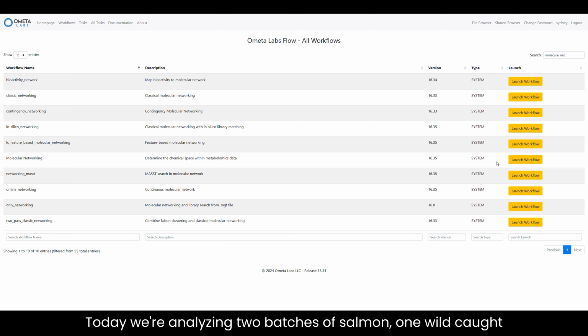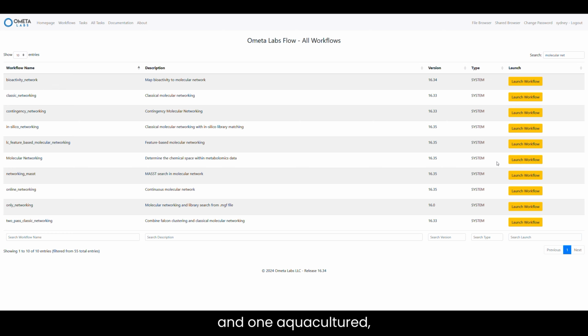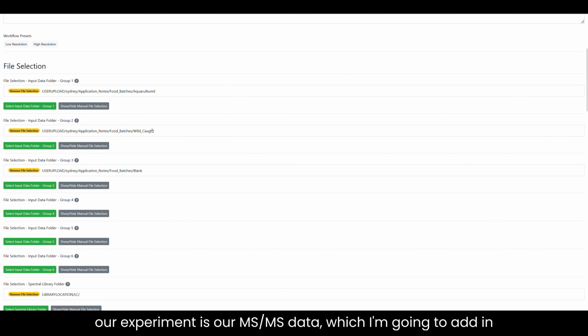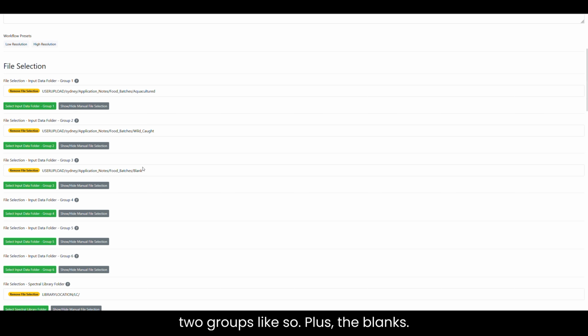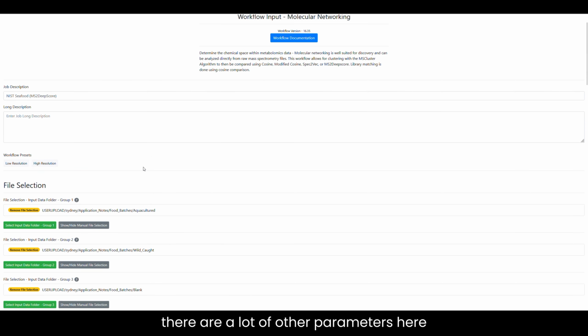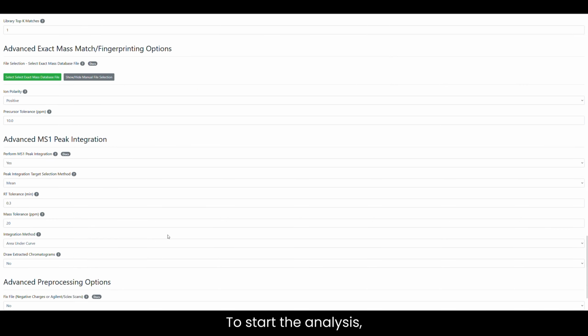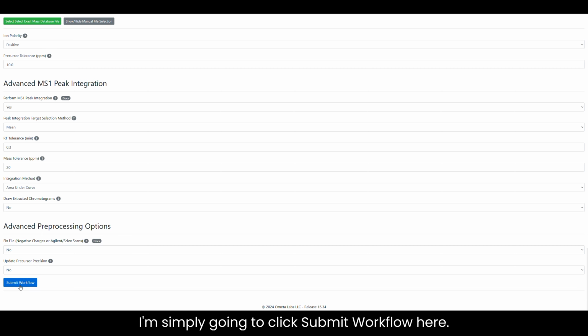Today we're analyzing 2 batches of salmon, one wild-caught and one aquacultured, to find out how they're different and how those differences might affect a final product. The first thing we'll do is run molecular networking, which is our all-in-one workflow that allows you to identify, annotate, and network your mass spectrometry data. All we need to start our experiment is our MSMS data, which I'm going to add in 2 groups like so, plus the blanks. You'll see there are a lot of other parameters here, which you can read more about in our documentation, or you can go to our Running Your First Molecular Network tutorial video. To start the analysis, I'm simply going to click Submit Workflow here.